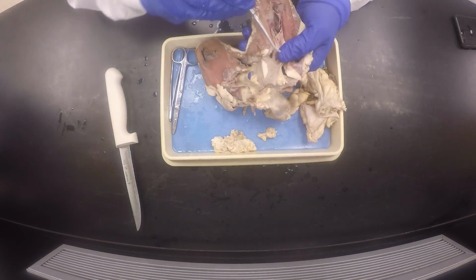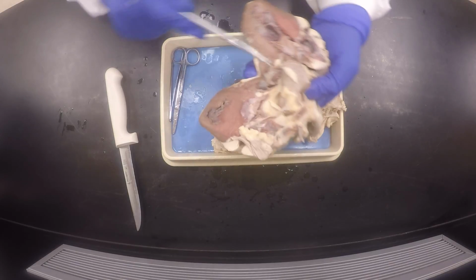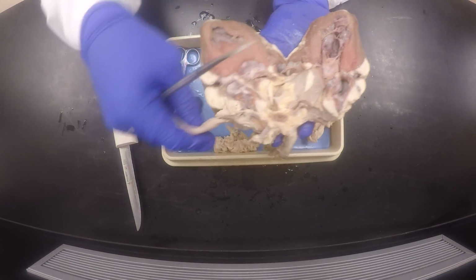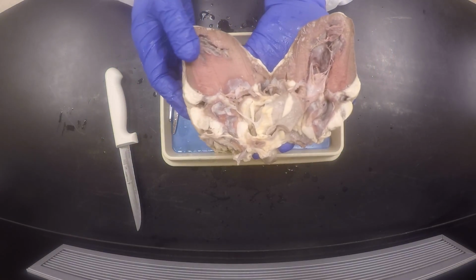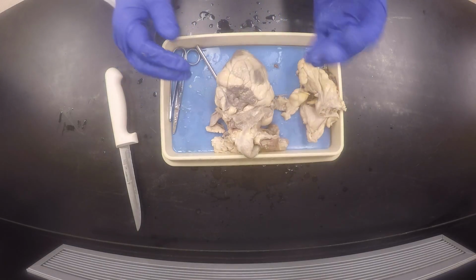As you go into this pulmonary trunk here, there's the pulmonary trunk. I think I'll have to do another heart anyway. But that's some of the internal parts. I'll do another one next time. Thank you guys, and I'll close it up and switch this off.